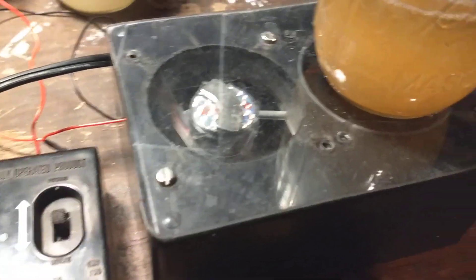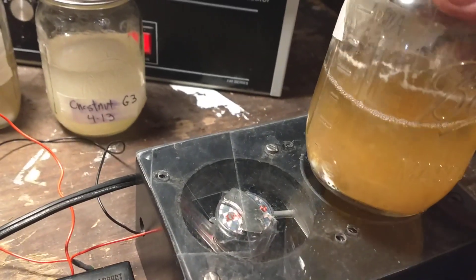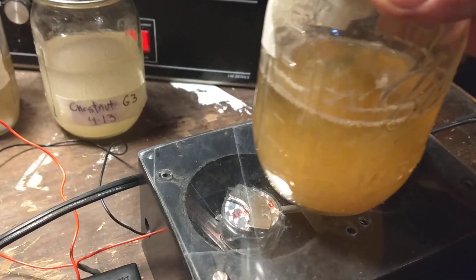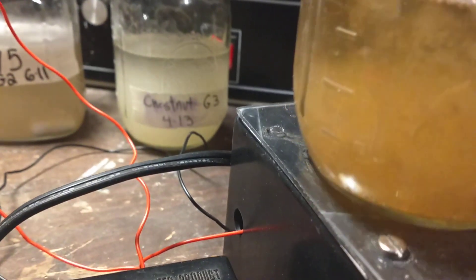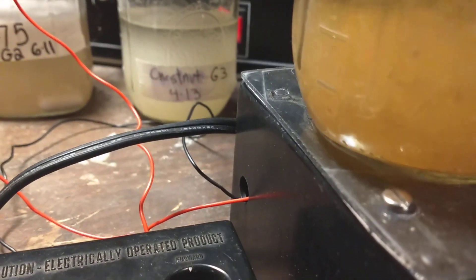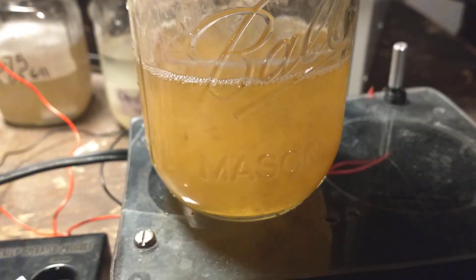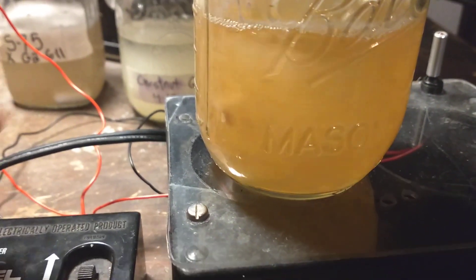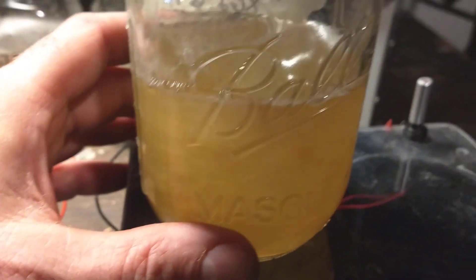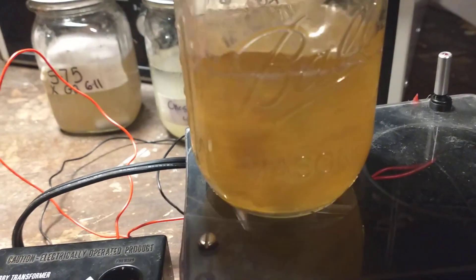I'm not sure why it doesn't spin in the other direction. I have some liquid culture here to show you how it works — I already mixed this up a little bit, but you'll get the idea. The bar is in there, so I've got to kind of get the bar to stick to the magnet. You can hear it and feel it better in person. Then I just turn this on. It's tapping a little, and sometimes you can move it around and get it not to tap — other times it just taps; it depends on the jar and the mixer.